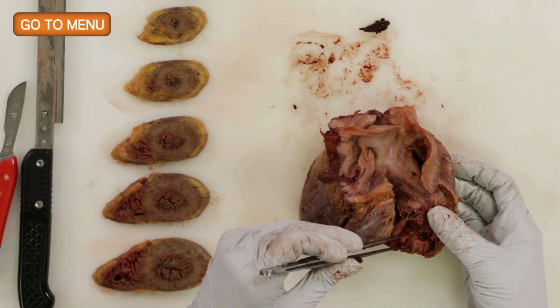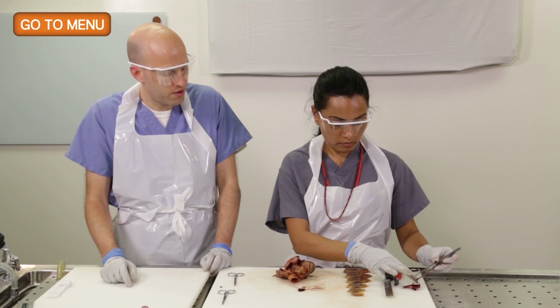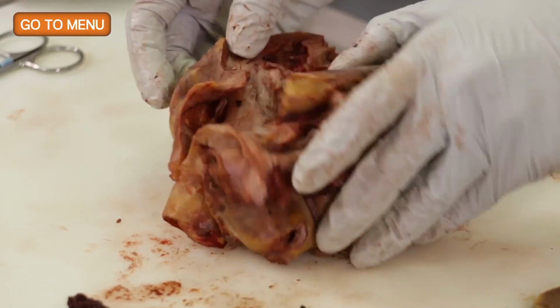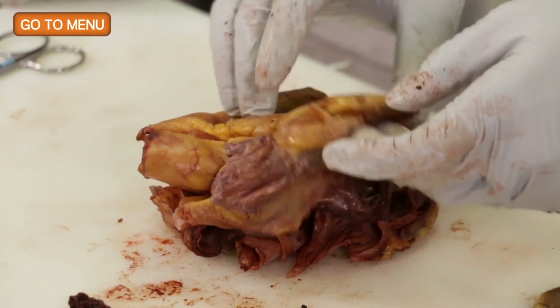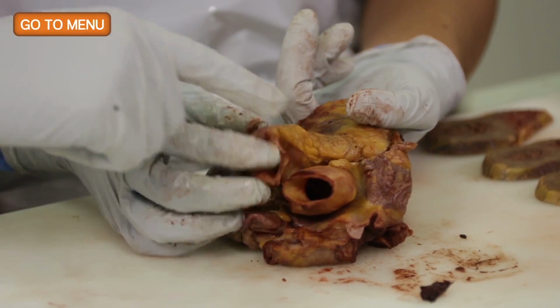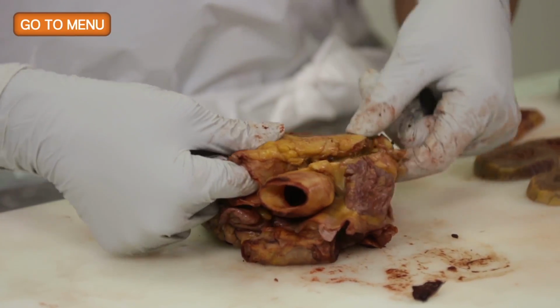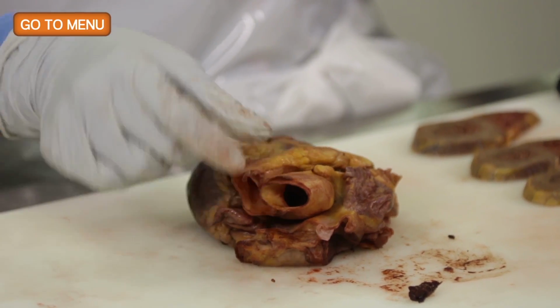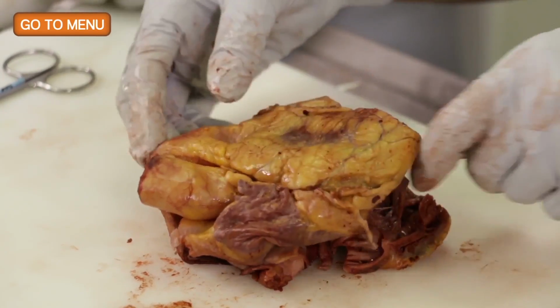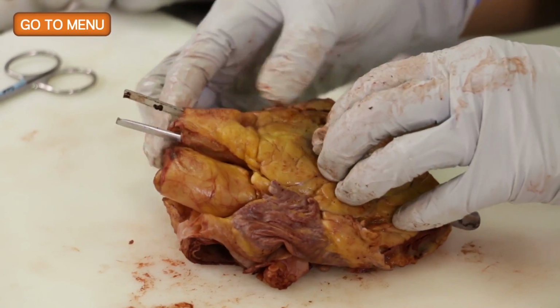Okay, so the next cut is from the right ventricle up through the pulmonary artery. We want to do that from the anterior surface of the heart and along the septum. All right, so again, here's your anterior, here's your pulmonary artery. That's your aorta. So you want to stay along the septum and go through the pulmonic valve up through the pulmonary artery. So again, using the probe helps to just stabilize your cuts a little bit.